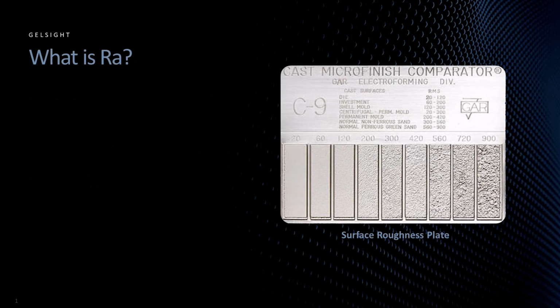So now that we have our primary, roughness, and waviness profiles containing the wavelength information that we are interested in, what can we do with this? Well, sometimes it's simply looking at the profiles themselves that will give you much of the information that you need, but not always. Quite often we need to quantify or put a number to the profile data.